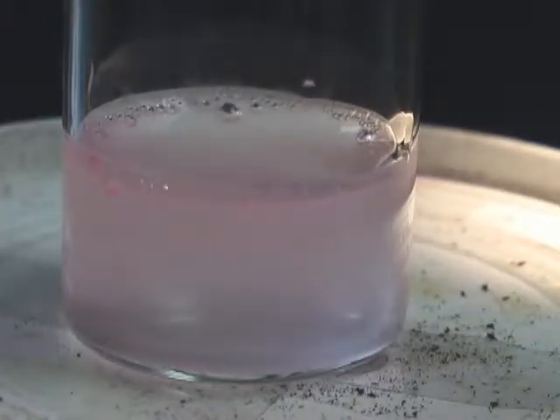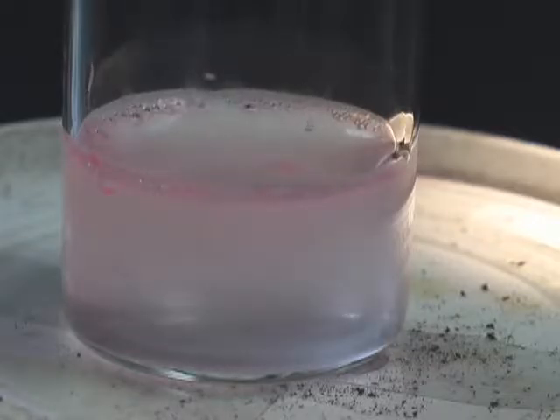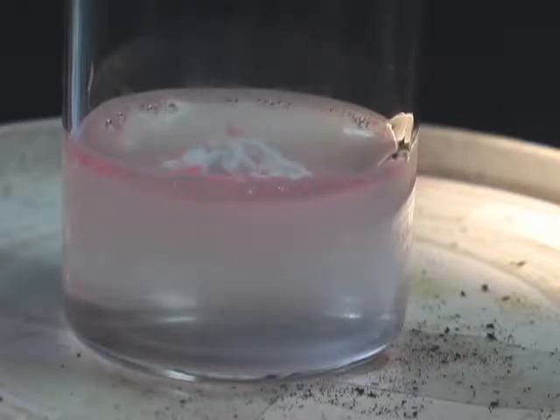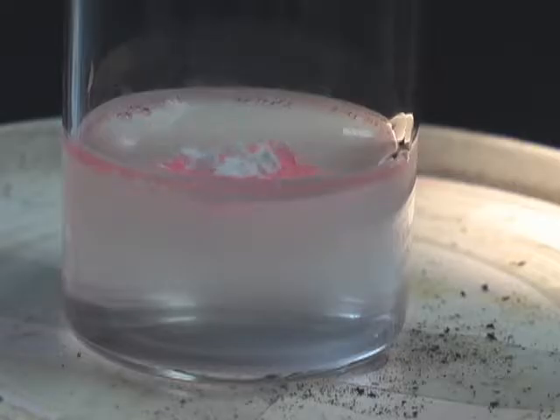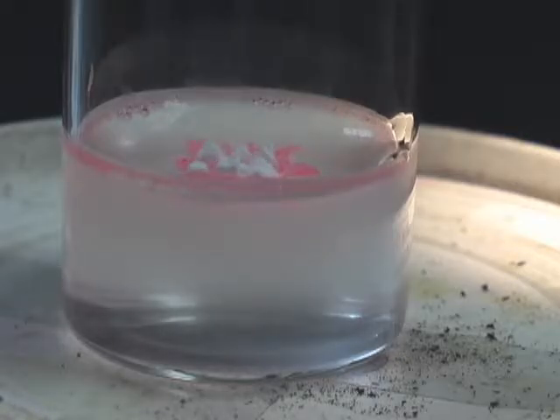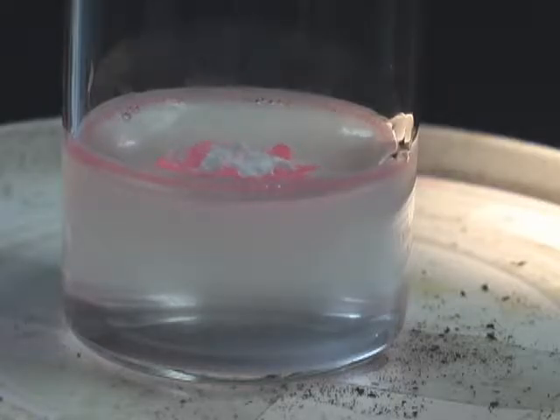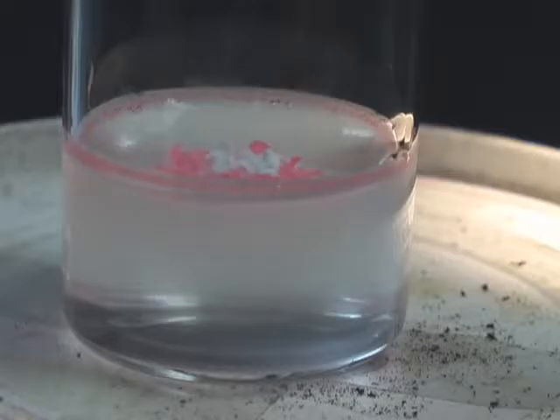The emulsion is now ready, and we will put our nanomaterial on the top. You can immediately see the change of color in the white nanomaterial. This corresponds with the cleaning of the emulsion.